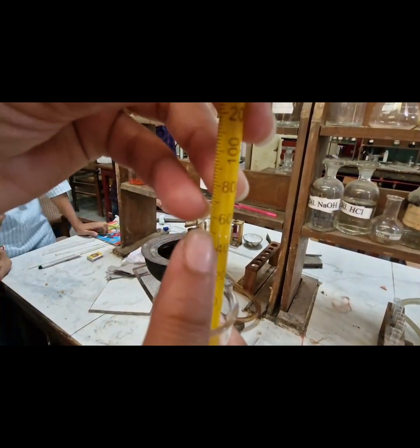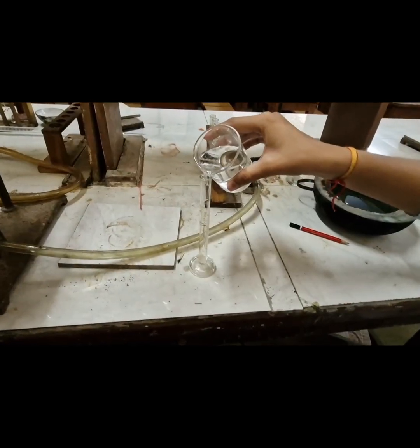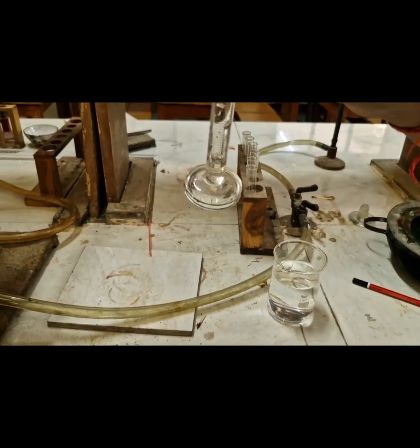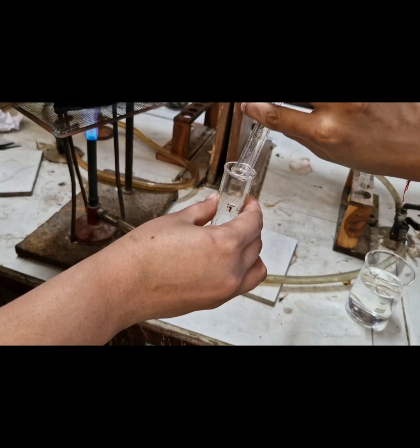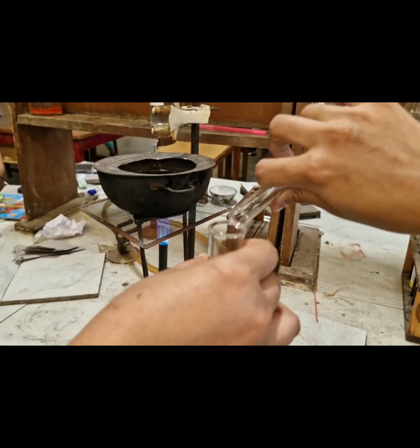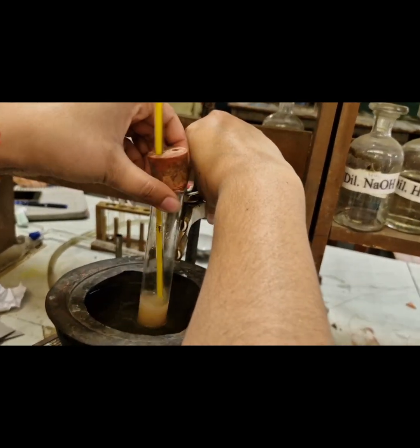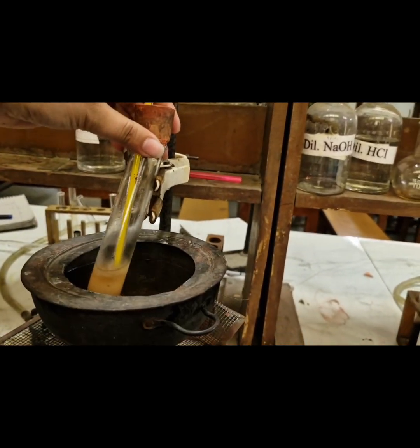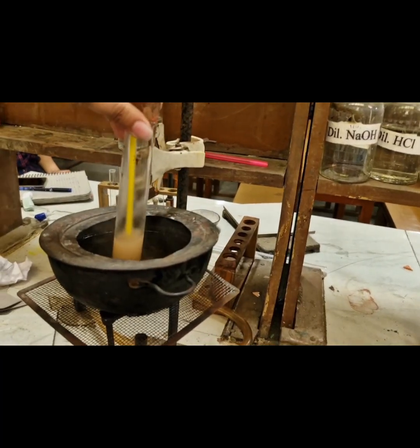In a similar way, we will take several readings. For example, again measuring 2 ml of water and pouring it in the same boiling tube, making the amount of distilled water in the boiling tube 6 ml. So now 6 ml of water is dissolved in 6 gram of phenol in the boiling tube. Now we will wait for the turbidity to disappear and note the temperature.